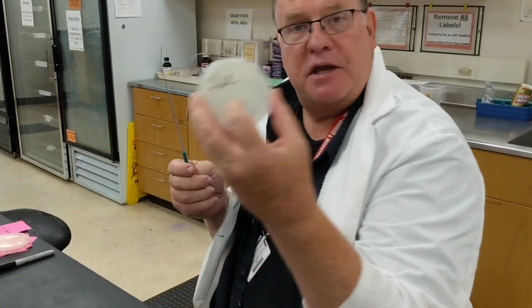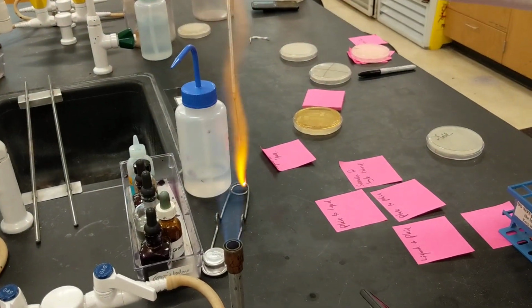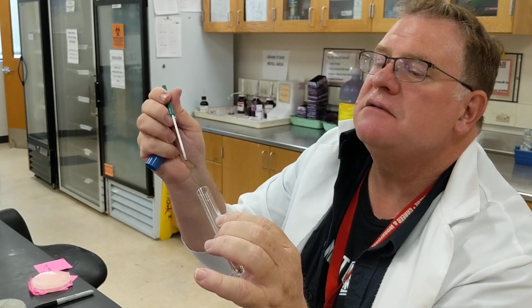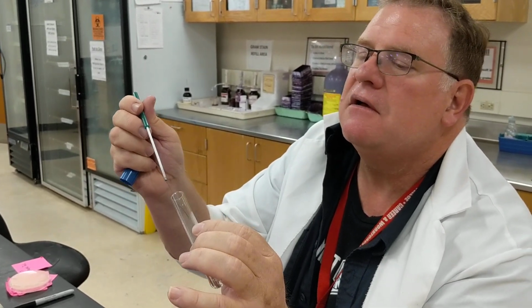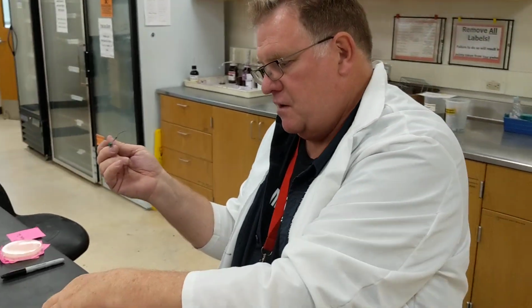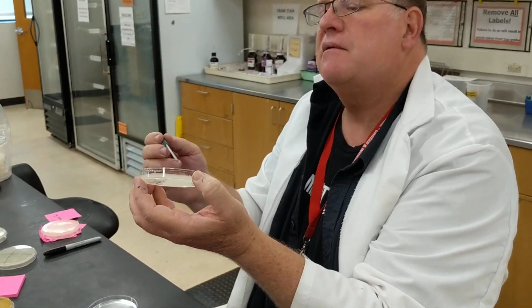Now the second thing that we want to do is go from a liquid to a plate. So here's an example of a plate. I'm going to sterilize my loop. Again, it's not the straightest it's been. In order to fix that, I would take time out to do it. And you are going to go in, just do it slowly, and it should be cool enough. I'm going to go in and grab a little bit of liquid. Okay, and then I'm going to go onto my plate, and I can inoculate my plate.